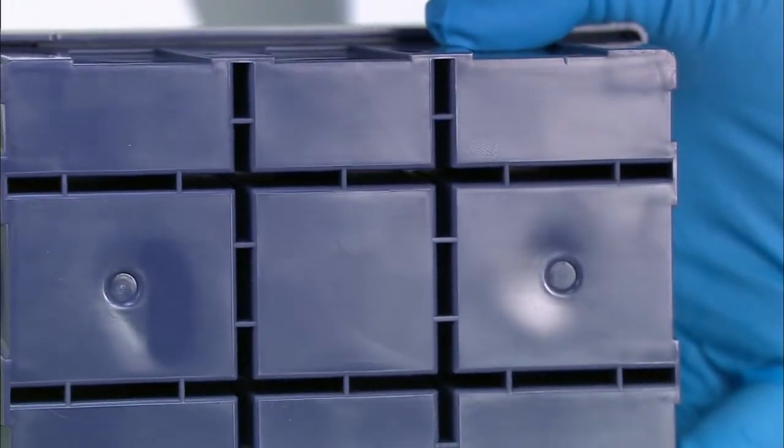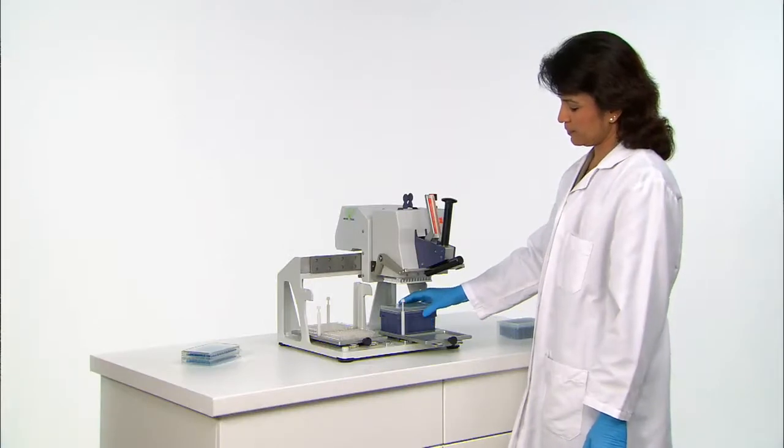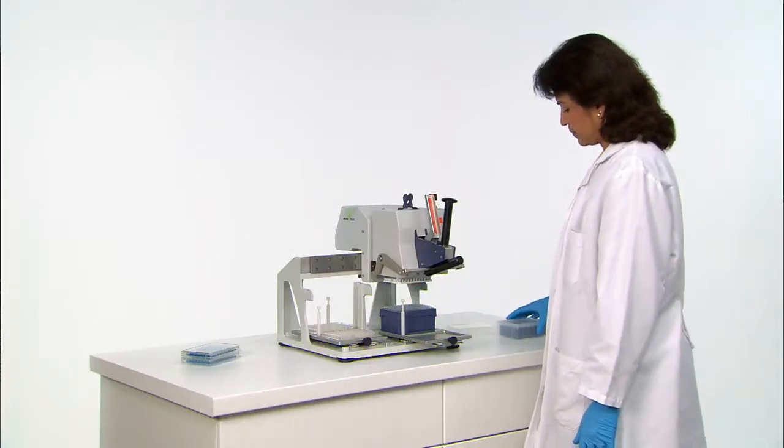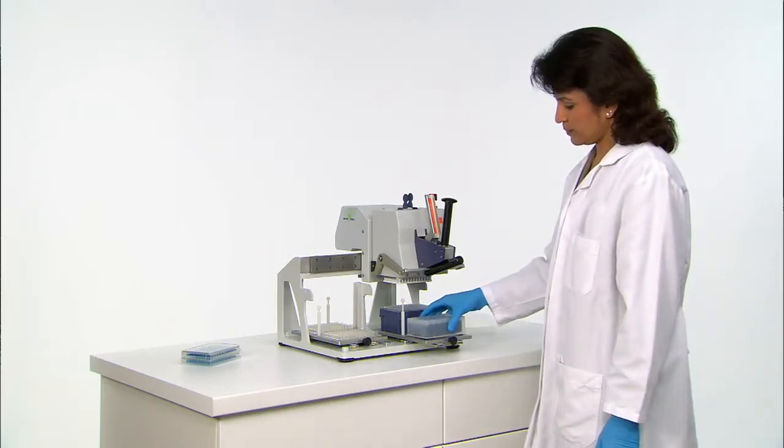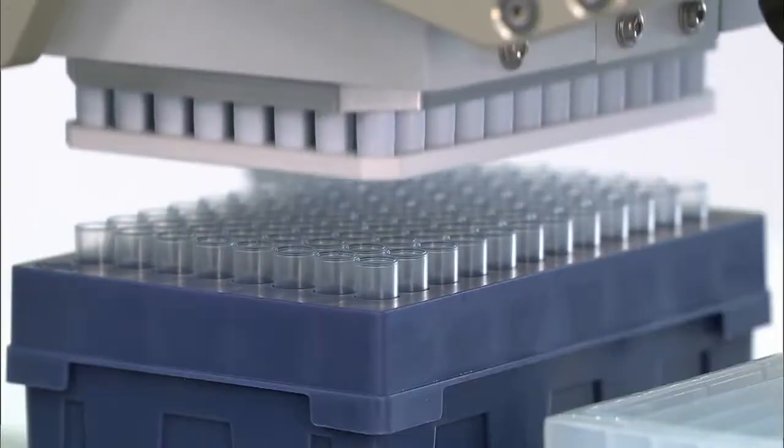On the right rear platform, the tip boxes have narrow grooves on the bottom which secure onto small pegs on the rear platform. Remove the tip box cover and load the reservoir onto the front platform.